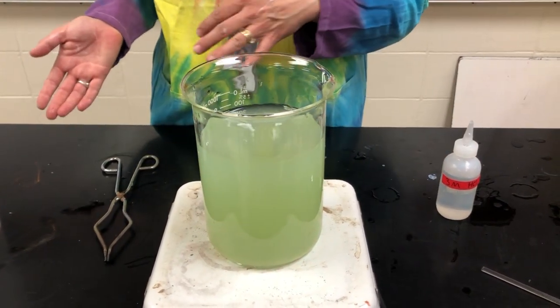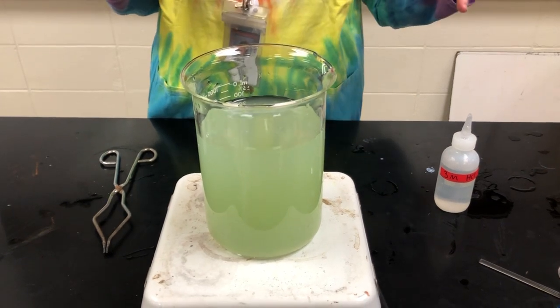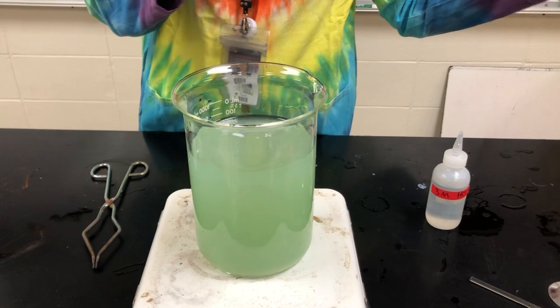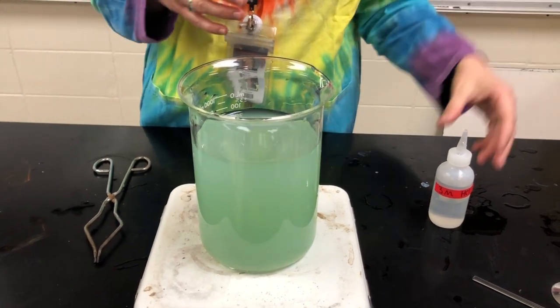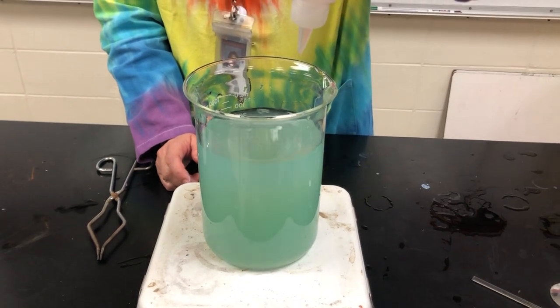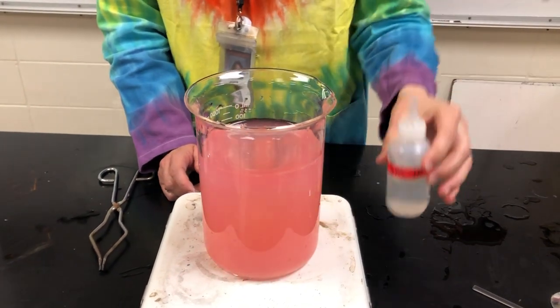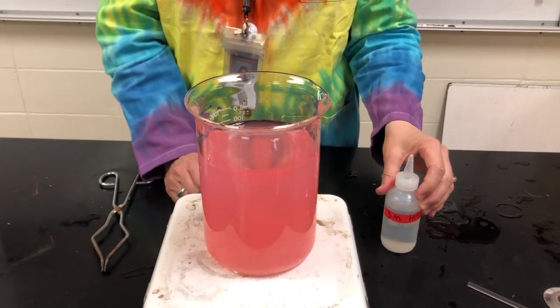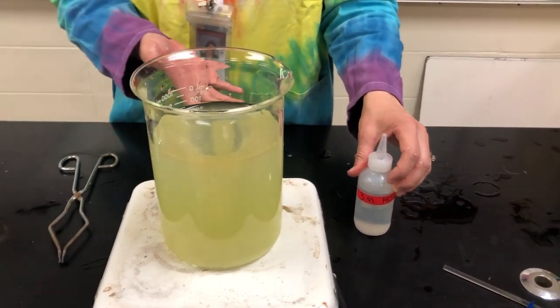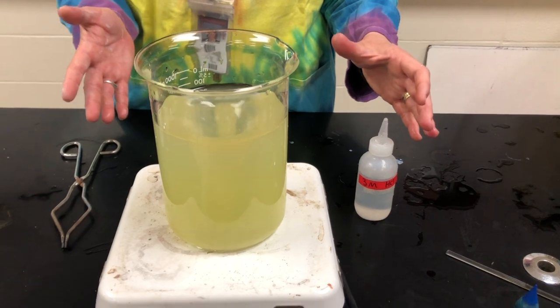So it's going through that host of color, that rainbow of color, but every time it doesn't get pushed all the way to that purple or to that blue, where eventually we're going to shift this solution to have that pH that's acidic. That's going to be represented by the red. Okay, so again, it's getting there. Now we're seeing it kind of hang at the yellow.